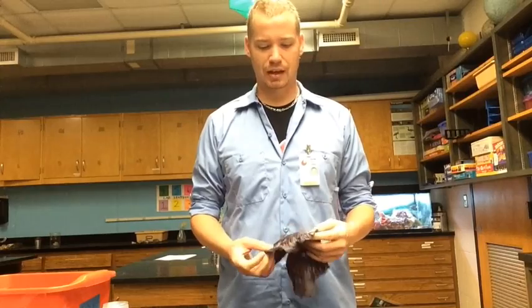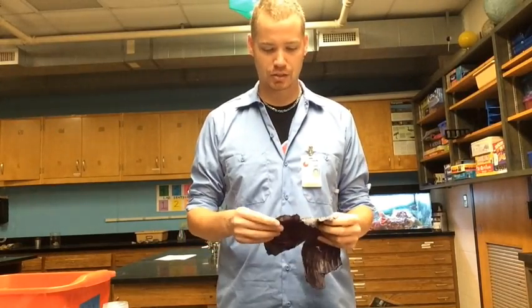Hello everybody. So today we're going to be doing an acid and base lab, and to do this you're going to have to make a pH indicator.